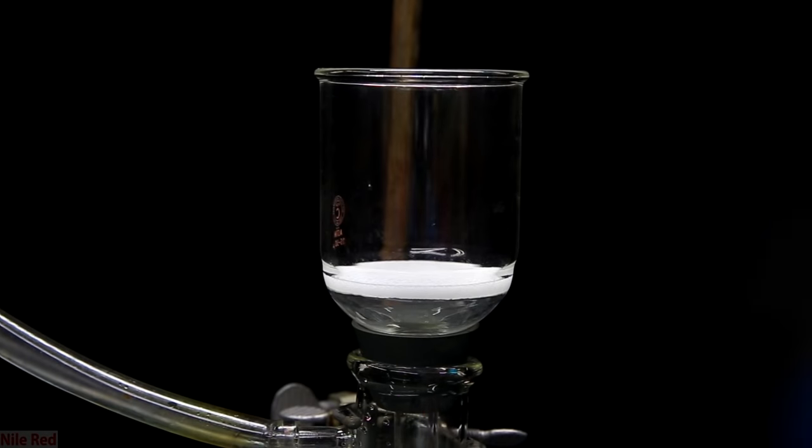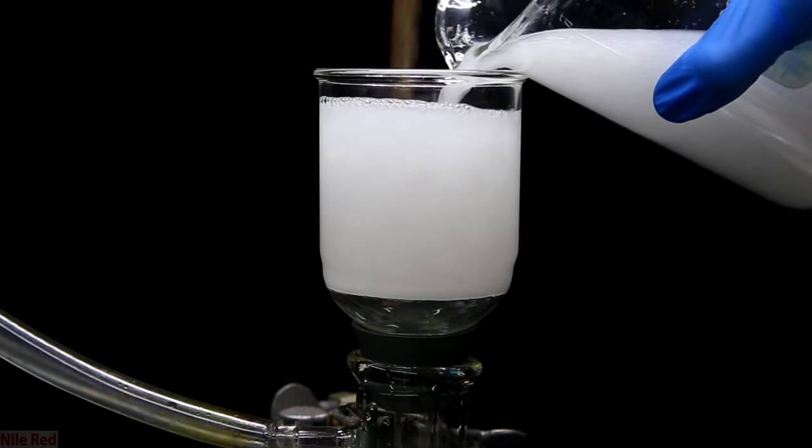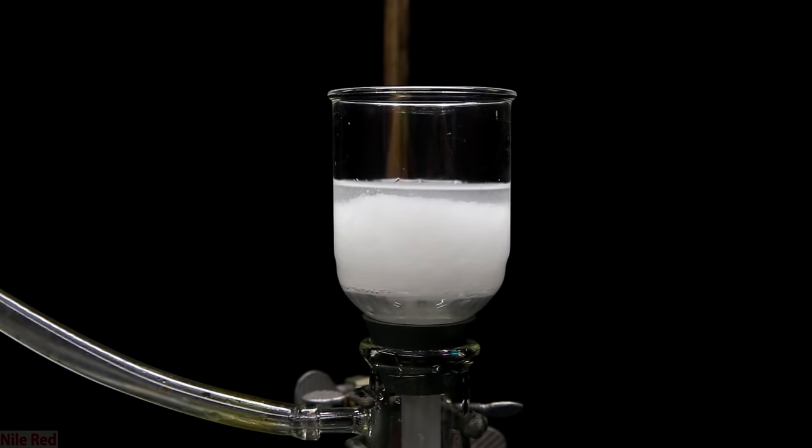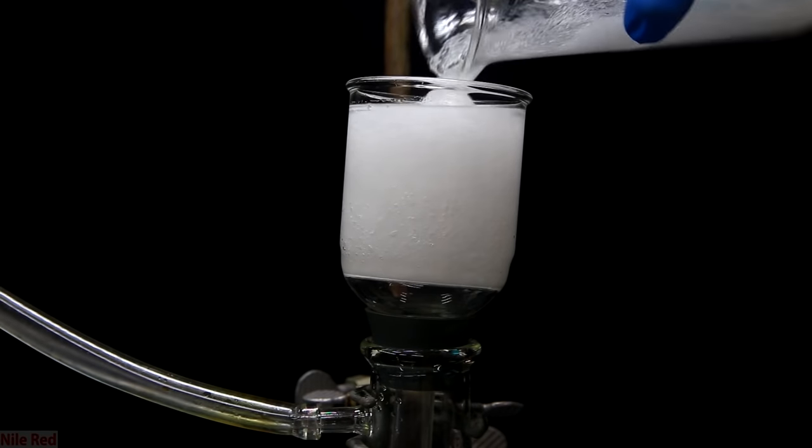I opted to use vacuum filtration, but of course gravity filtration is perfectly acceptable as well. I start out by dumping in as much as my filter will hold. I then pull the vacuum to get rid of the ethanol. Once all the ethanol is gone, I can add more stuff to filter.